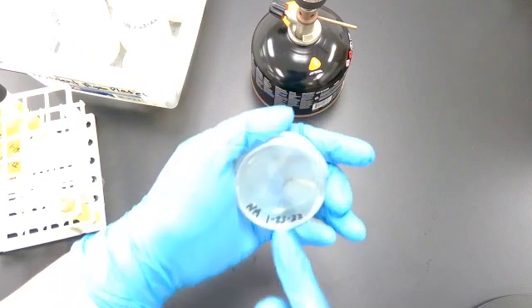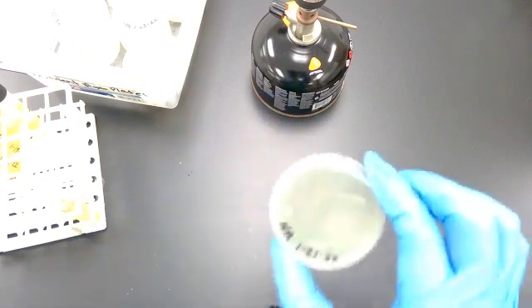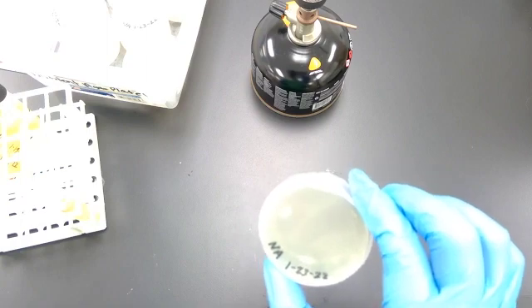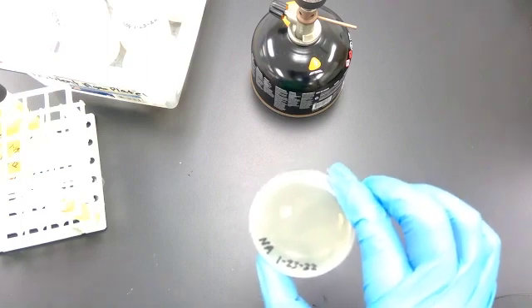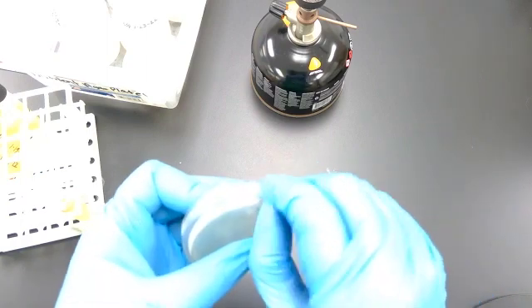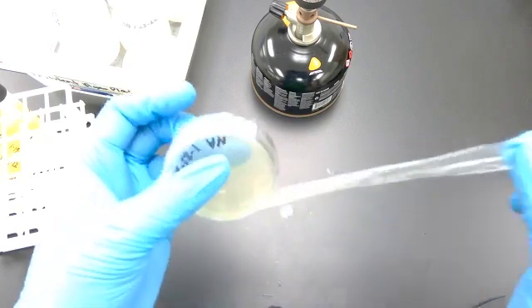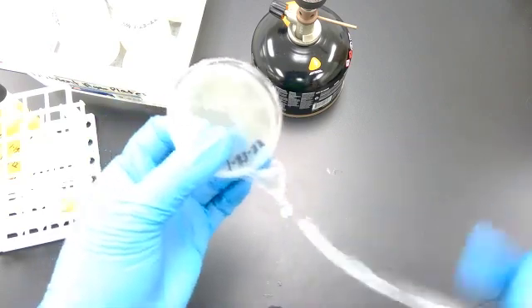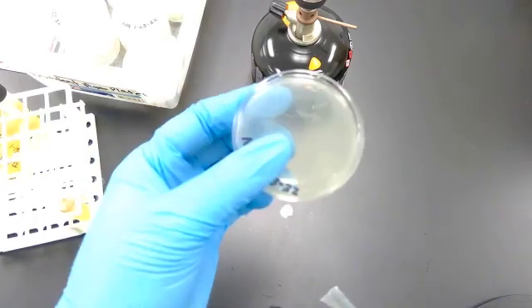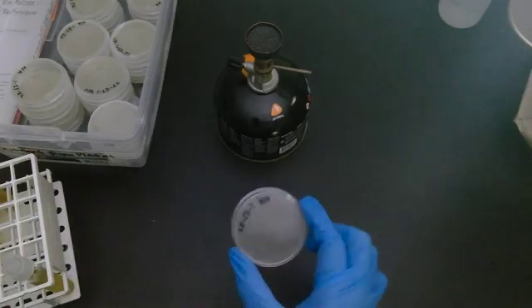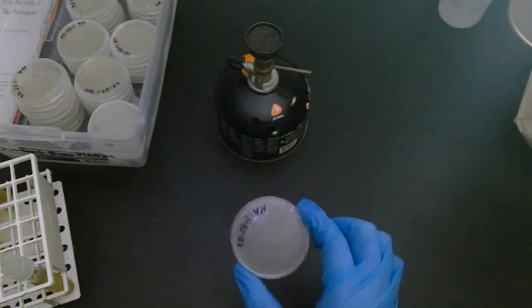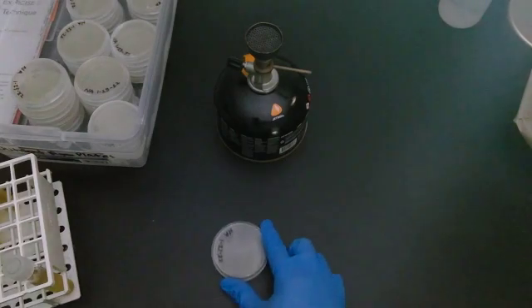You can see the date right there. Whenever you make plates, you always date them so that you know exactly how old they are and when they were made. This is parafilm. I always seal the plates so they can't dry out.